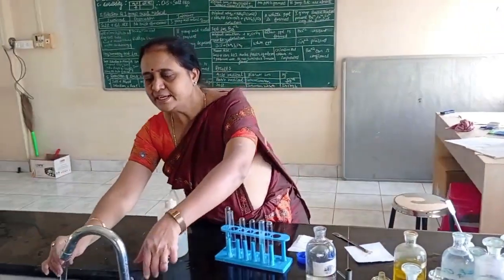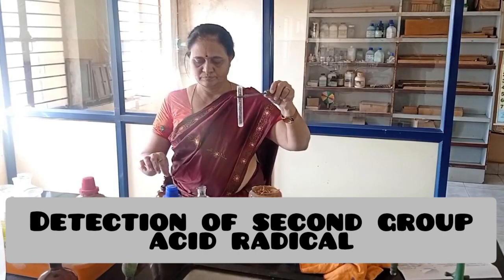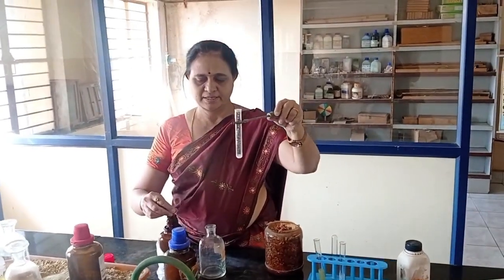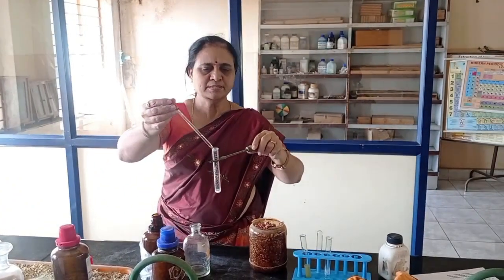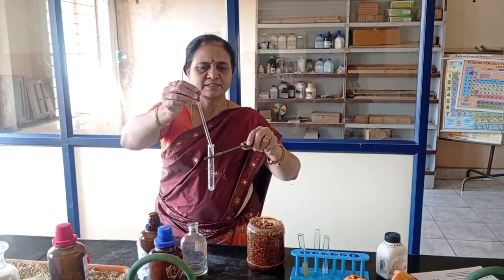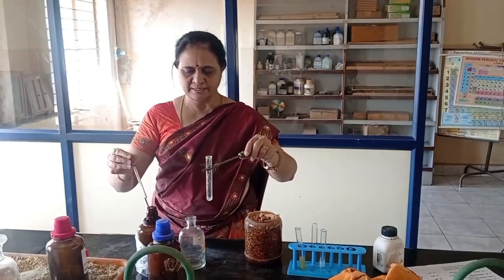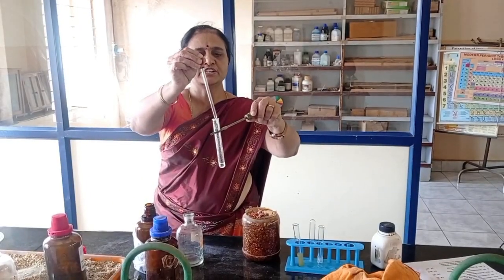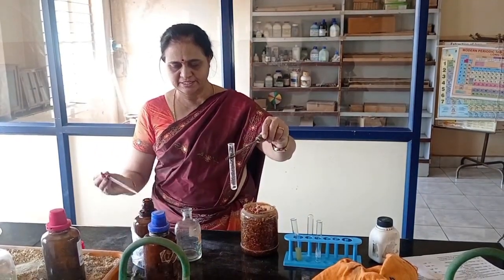Now I will check the presence of second group acid radical. See here, I am taking a salt in a dry test tube. For this, I am adding concentrated sulfuric acid. Salt in a dry test tube plus concentrated sulfuric acid. No reaction in cold condition. No characteristic gas evolved in cold condition.